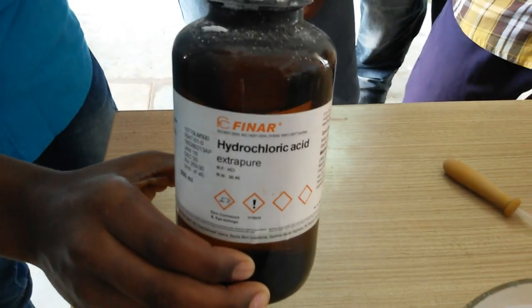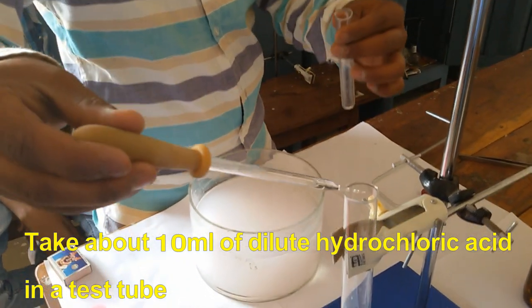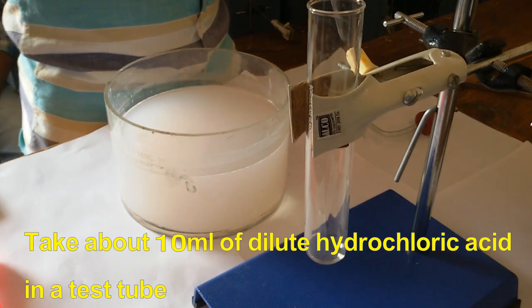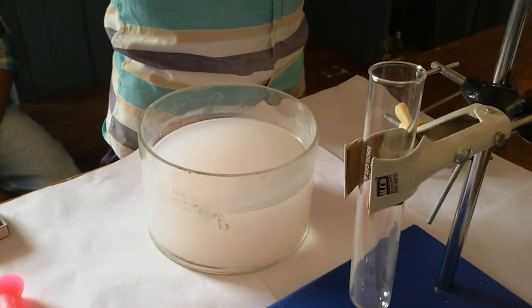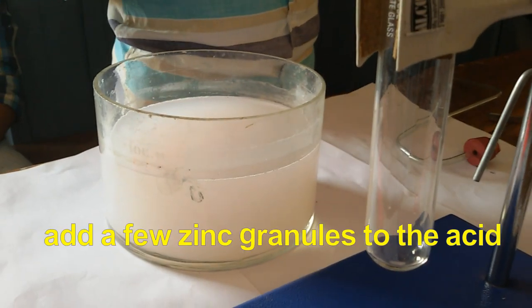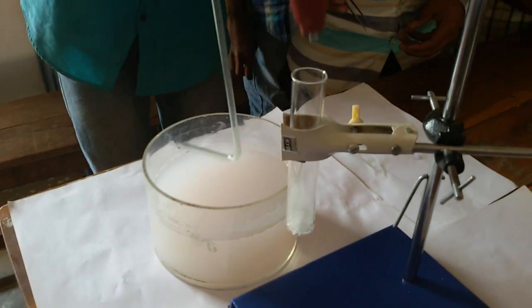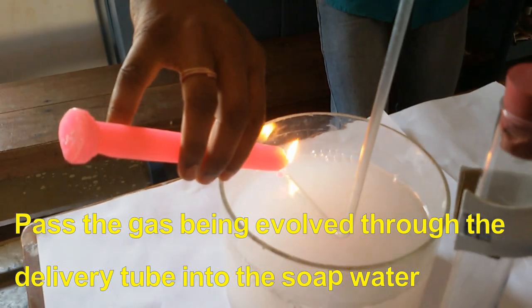Take about 10 ml of dilute hydrochloric acid in a test tube. Be careful, don't pour it on your body while transferring this hydrochloric acid. Add a few zinc granules to the acid which we have taken in the test tube. Pass the gas immediately being evolved through the delivery tube into the soap water.